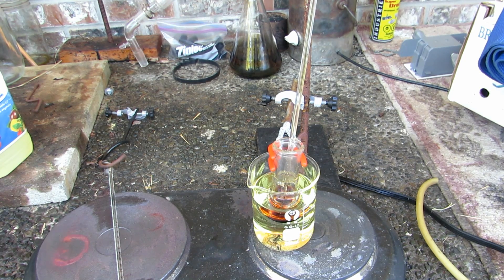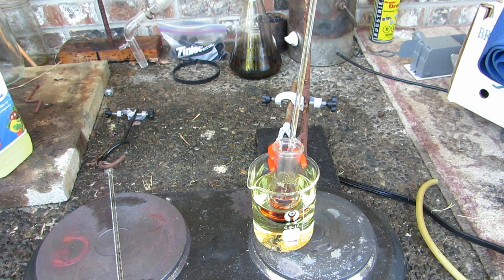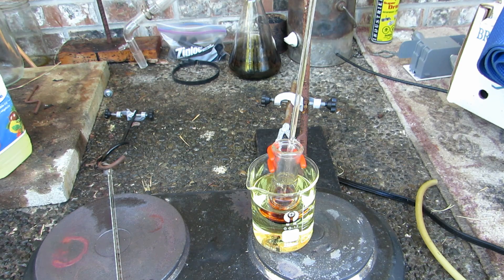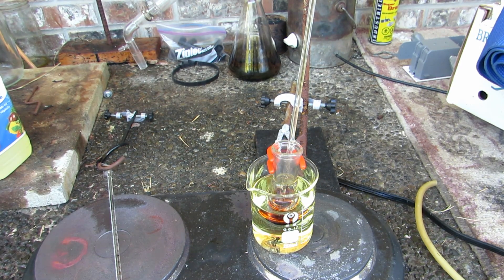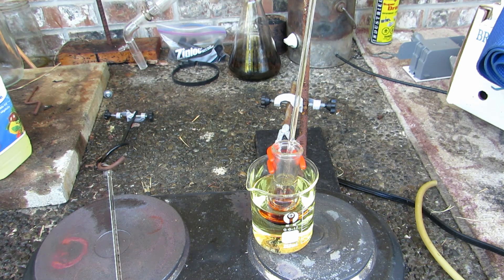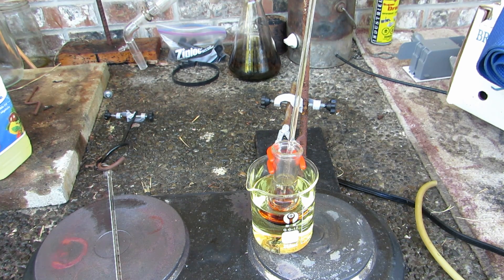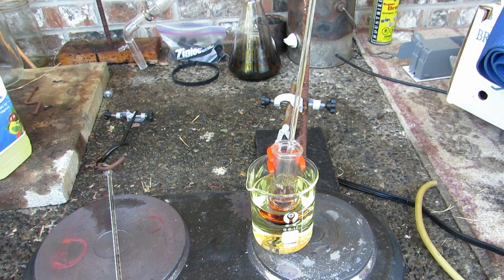It's been about half an hour; the oil bath has been steady around 140 to 150 degrees Celsius, and our solution has now turned very very dark red — like blood red. At the beginning it separated into two different layers when it wasn't red, so I had to use the stir rod to mix it around to get it to start reacting. Now it seems like it's all a one-layer phase mixture. We're going to continue heating for probably an hour to an hour and a half — that's definitely the color of phenolphthalein, I'm very excited.